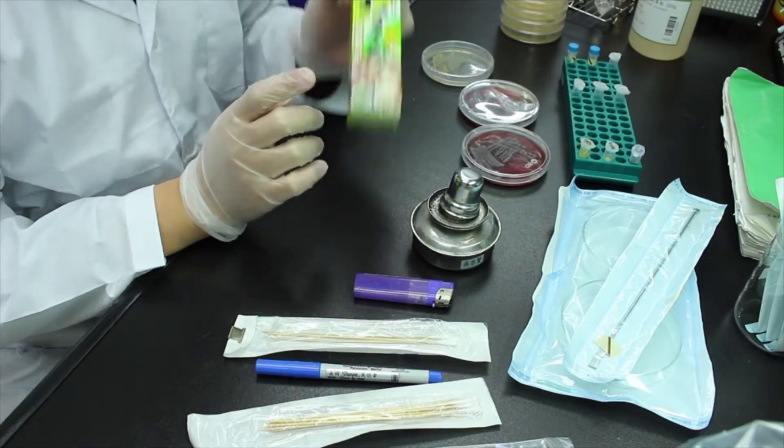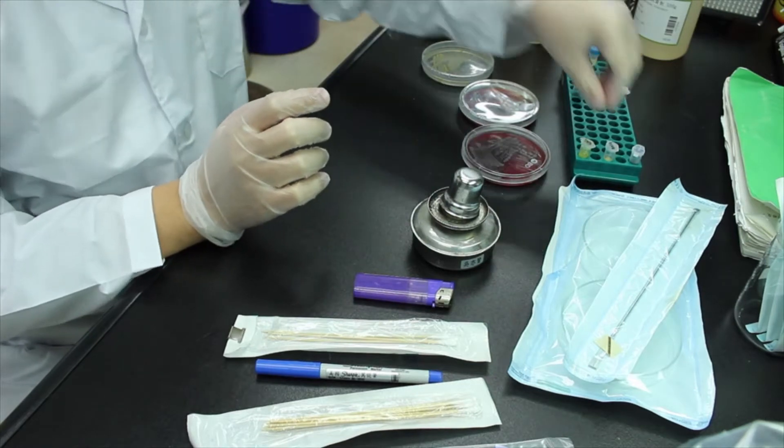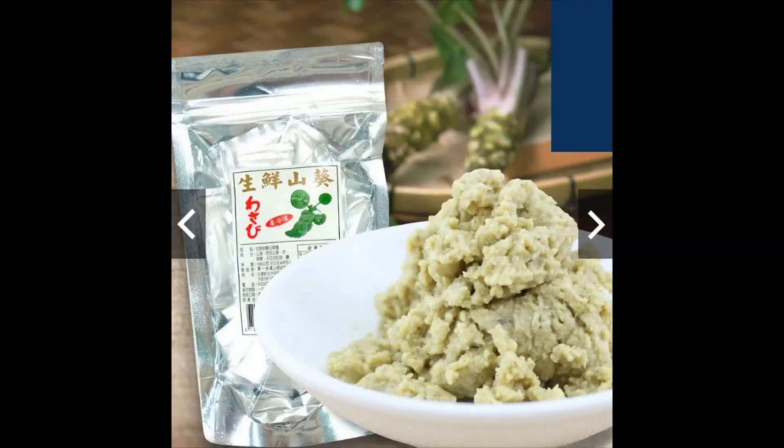And the next one is the frozen wasabi paste, which is real wasabi and it does not contain any preservative or food color. So I think this is the best I can get besides buying a fresh wasabi and grinding it by myself.